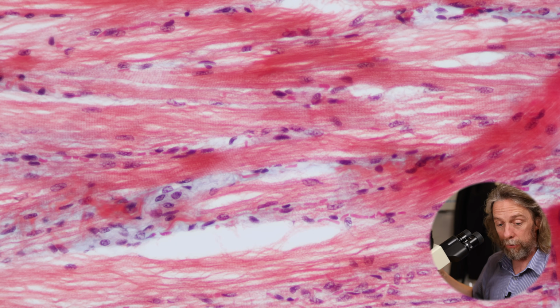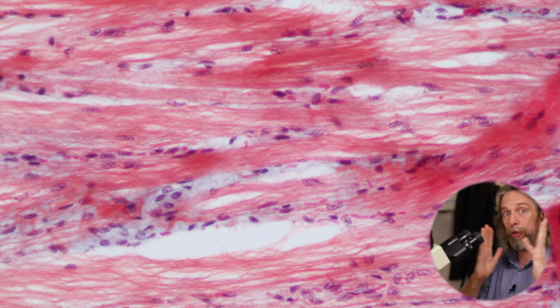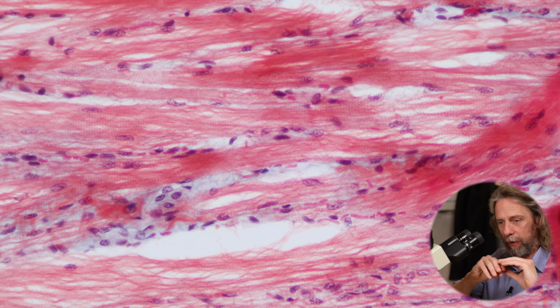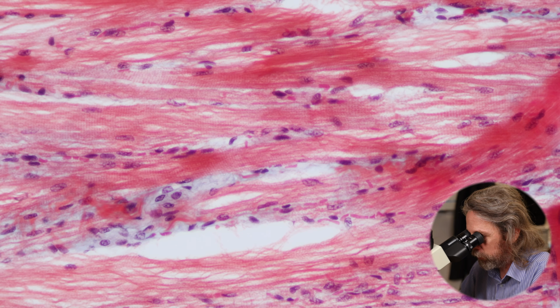So these are very long cells. We see lots of nuclei around the outer edge of the cells. This has happened because when the muscle formed, there were lots of individual cells. And then they joined up. They lost their cell membranes in between one another. This is called a syncytium. So lots of cells joined together, lost the cell membranes that were separating them, forming very, very long cells, which is why there are so many nuclei, because each nucleus has come from one of those individual cells. So we've got long cells, nuclei around the outside, formed from multiple myoblasts or progenitor cells.